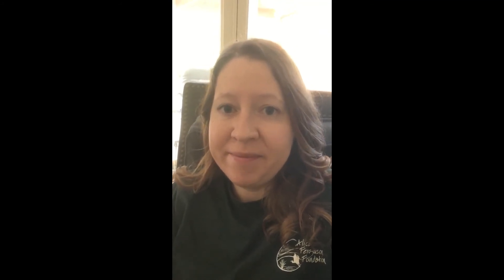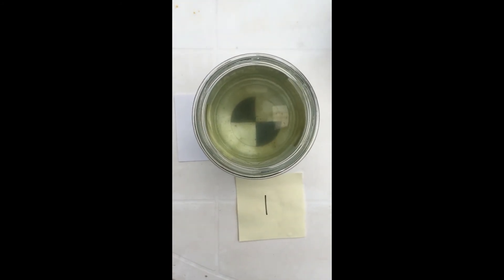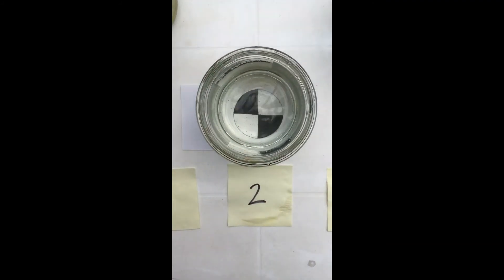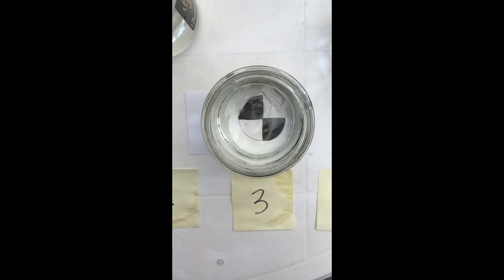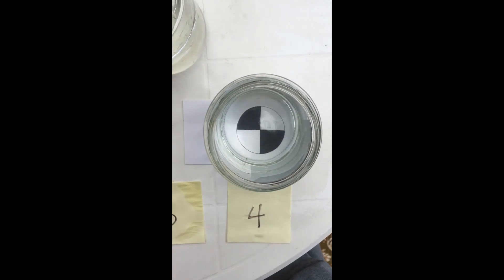So it's been 10 days, so let's go take a look at what's developed and write your day 10 observations on your data sheet. Number one is stream water with 100 milligrams of fertilizer. Number two is stream water with 100 milligrams of fertilizer, which we placed in the bag. Number three is stream water with no fertilizer added. Number four is distilled water with 100 milligrams of fertilizer.